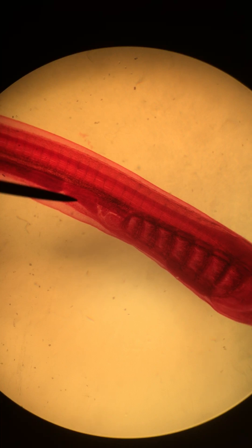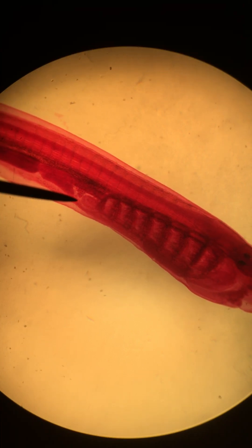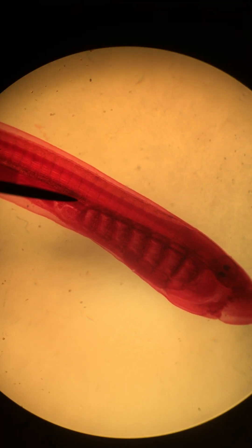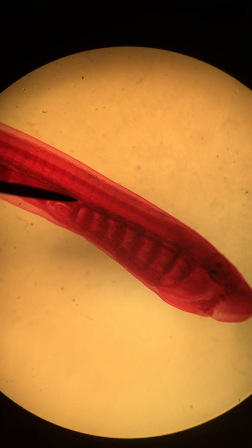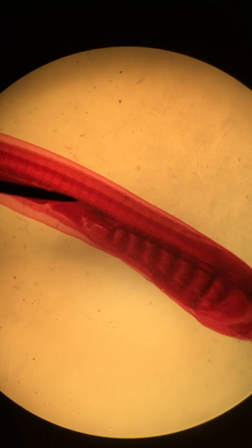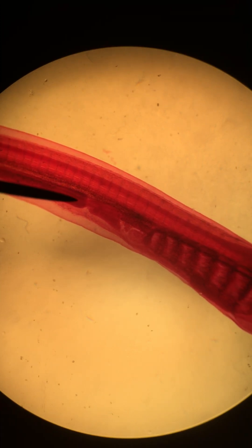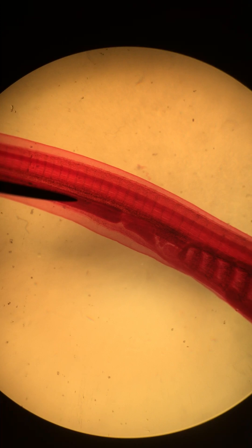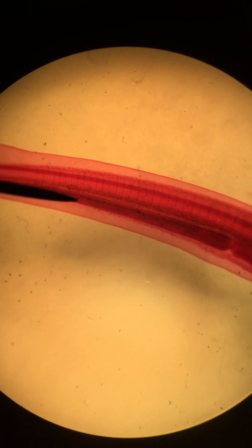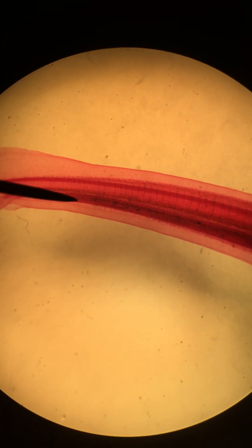Before I go too far, I want to mention the esophagus, which is right here — this tube. It connects the pharynx to the intestine, which starts right here. This is the intestine.